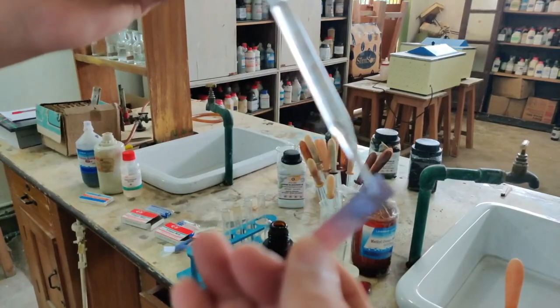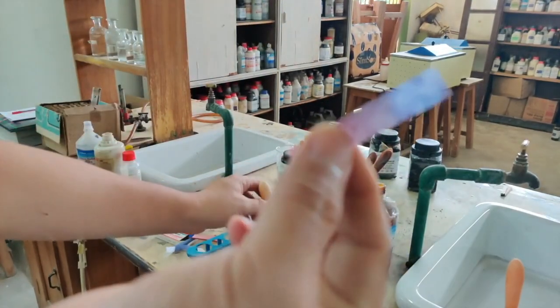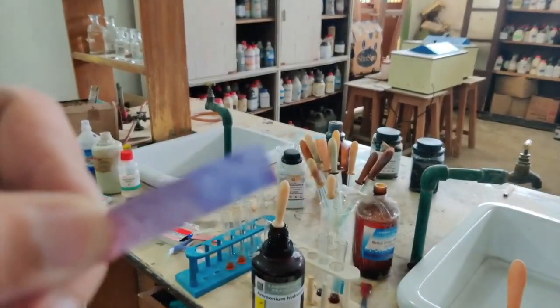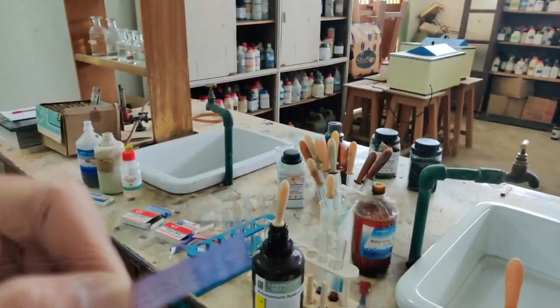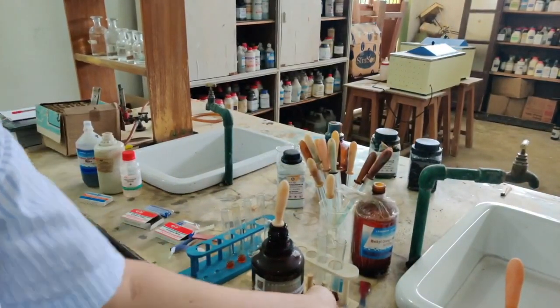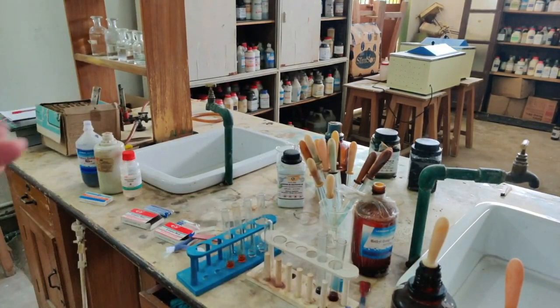See this, see how the litmus has turned its color to blue. So it was a red litmus, but then the red litmus has turned blue. So you can see how nice a blue color it has turned to. So this is how the paper works. So I have shown you both the solution as well as the paper in terms of the litmus, that is, in terms of your red litmus and blue litmus. Now let's go to methyl orange.